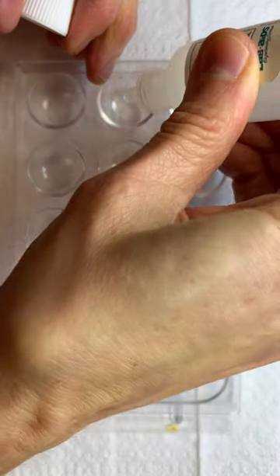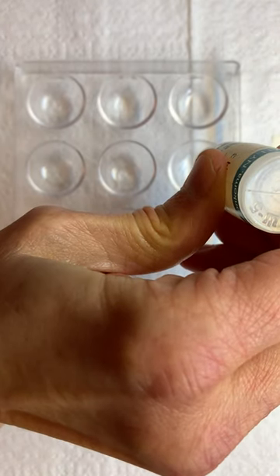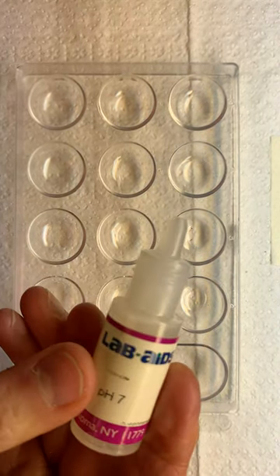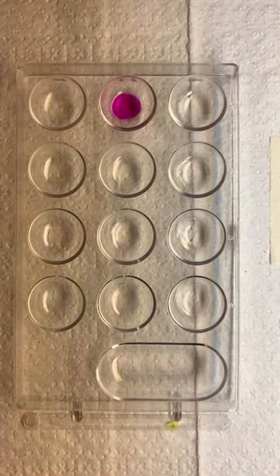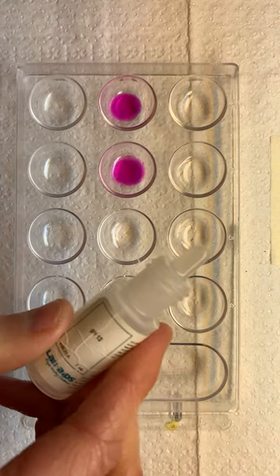We're going to add one drop of phenolphthalein to wells one through seven, and then we're going to add our drops of pH again. So pH 1 — we're looking for a change. pH 3. pH 5. pH 7. pH 9. Magic of chemistry, folks. pH 11. And the last one, pH 13.